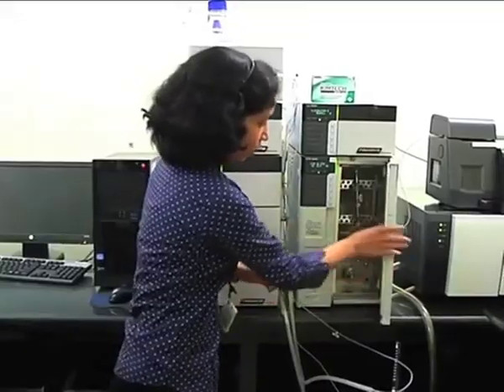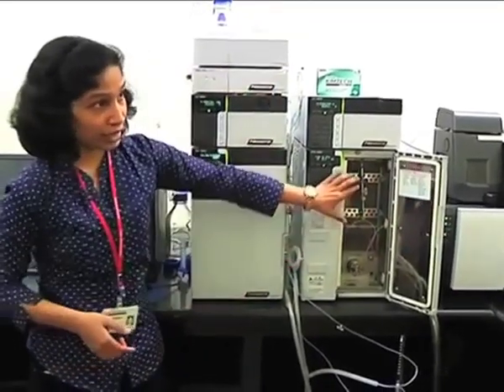Now we will move on to, have you observed that the columns we are using for this analysis, fast HPLC, are fast columns, or UHPLC columns. These are different from your conventional analytical column. A conventional analytical column will be 150 to 250 mm, that is 25 centimeters, in length, with 4.6 mm ID and 5 micron particle size. But these columns are fairly short. Their IDs are also low, and the particle size is 2.2 micron or 1.6 micron.